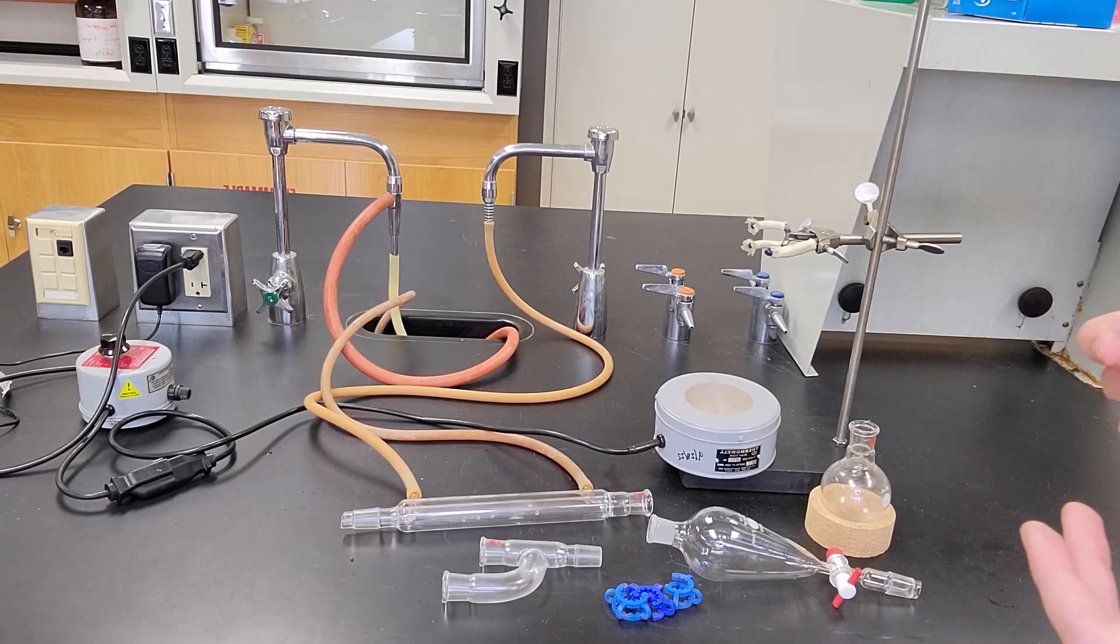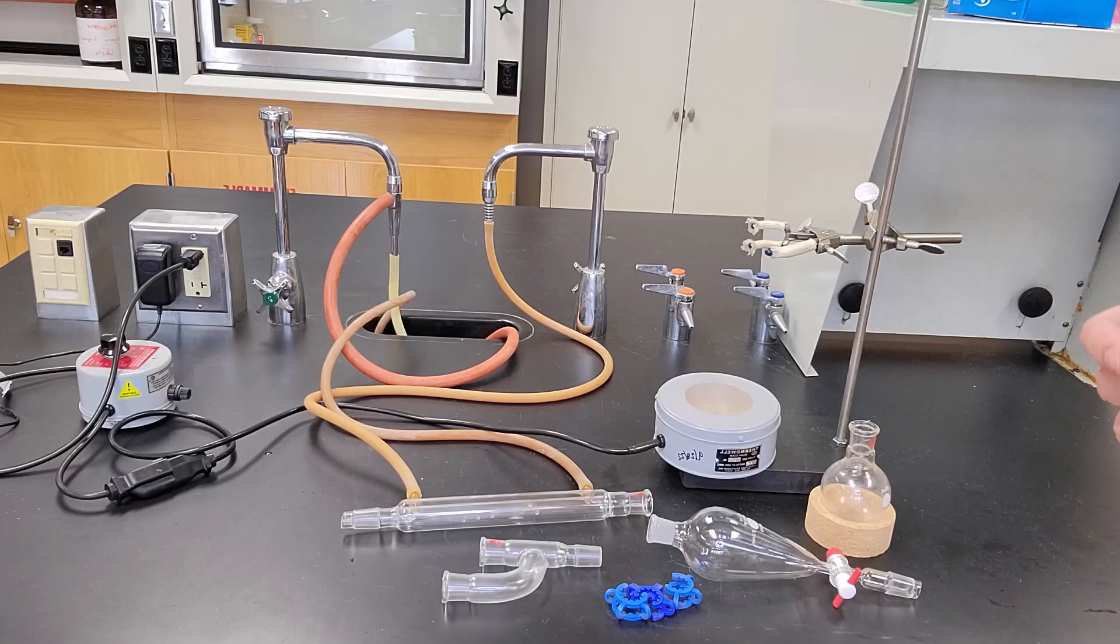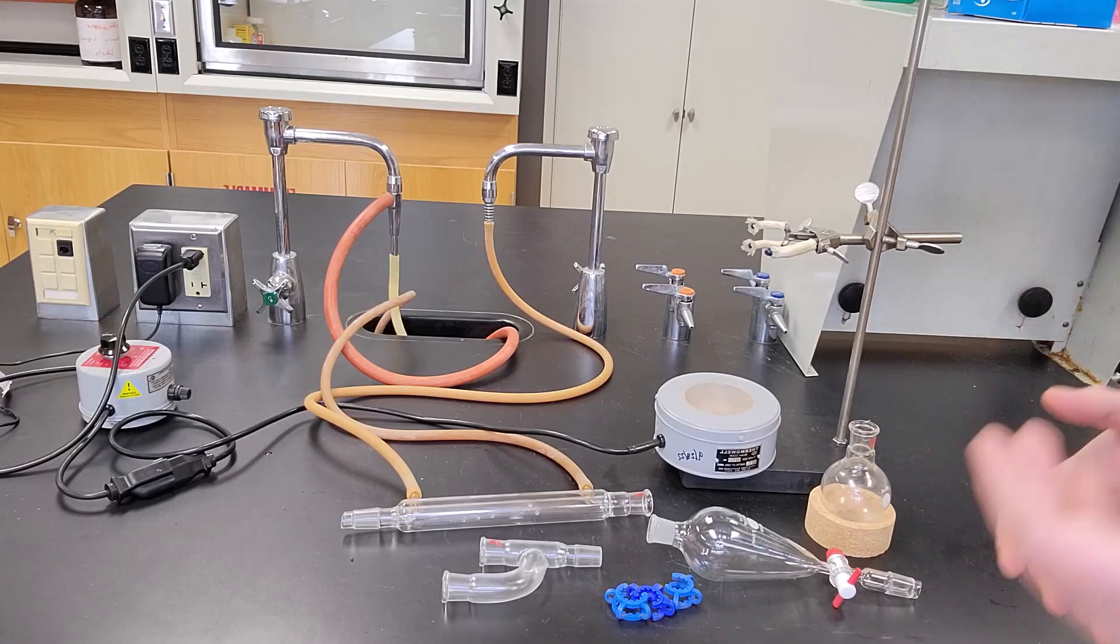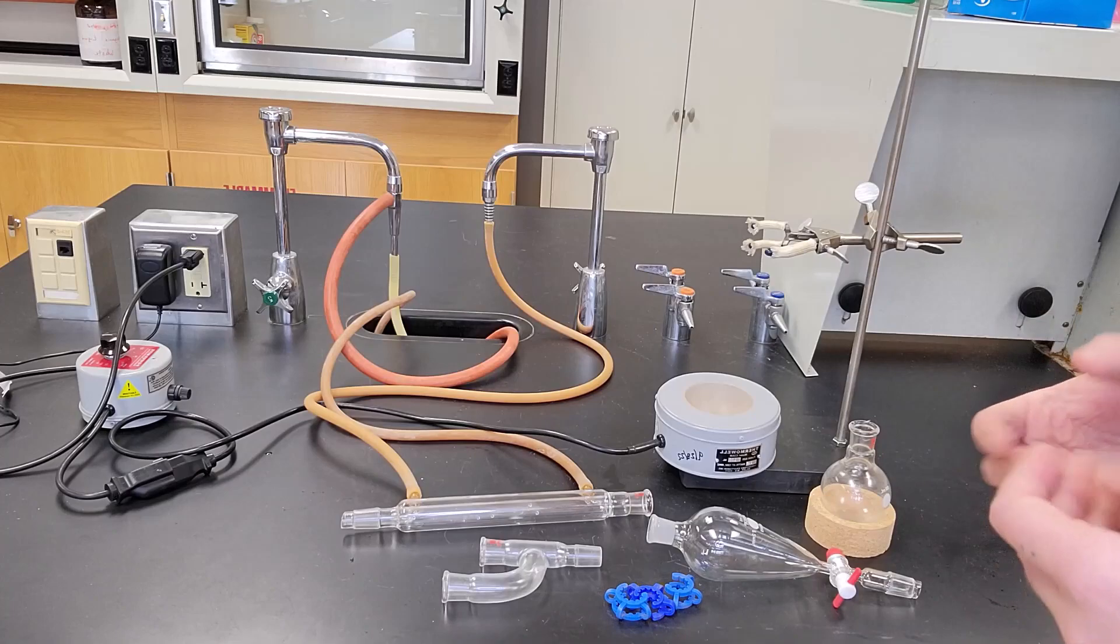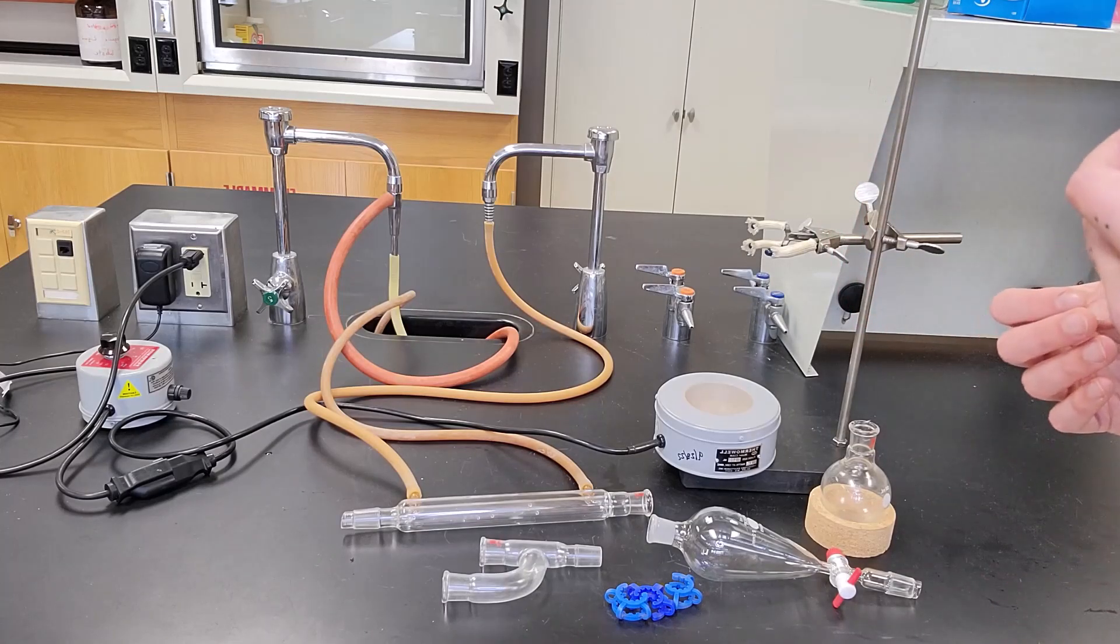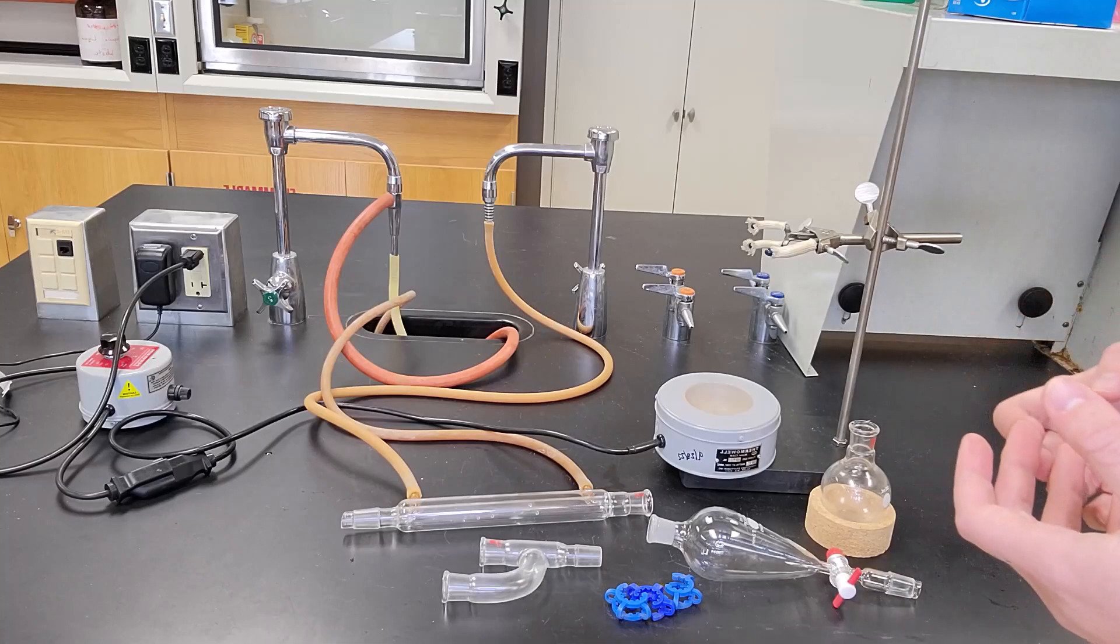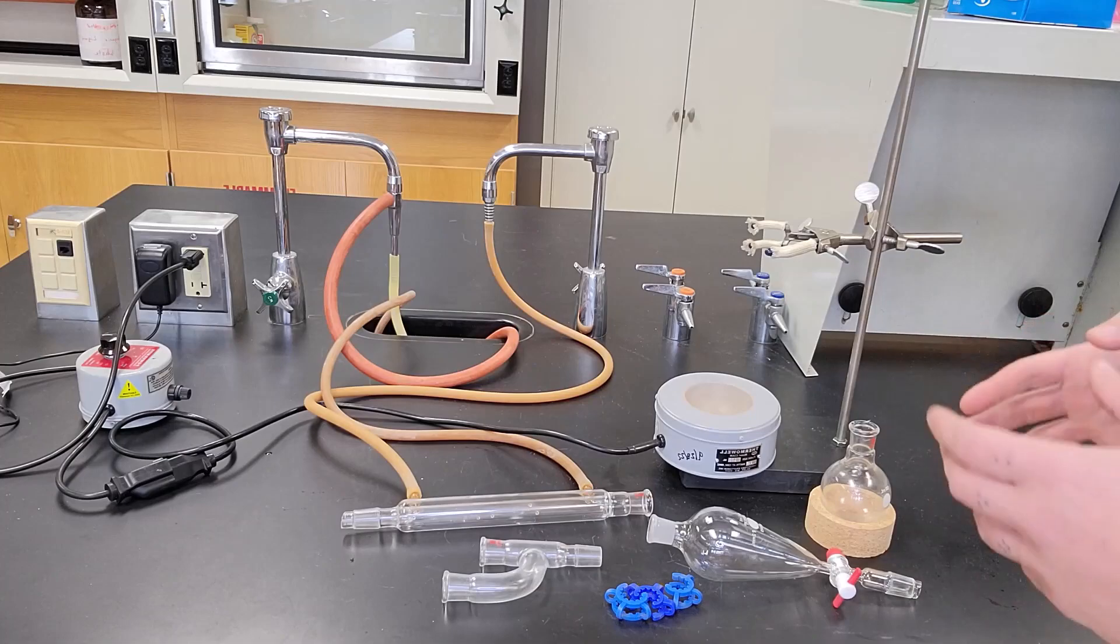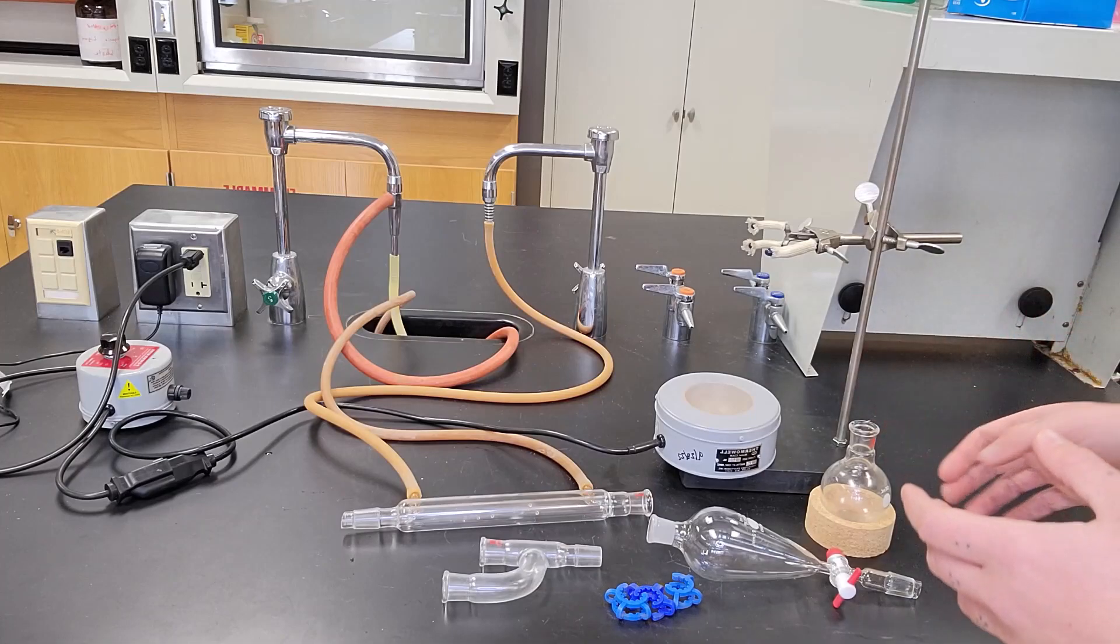So in the reaction that we're doing with the addition through an addition funnel, if we run into the case where it adds a little bit too fast and it starts to boil, we can have the reflux condenser catch that solvent and avoid having it evaporate away. So I'm going to walk you through how to set up an addition funnel coupled with a reflux condenser.